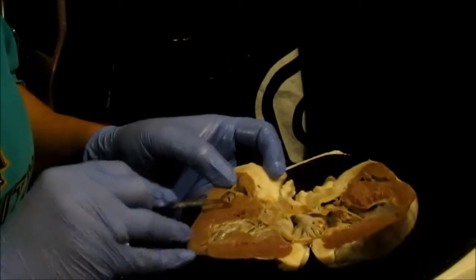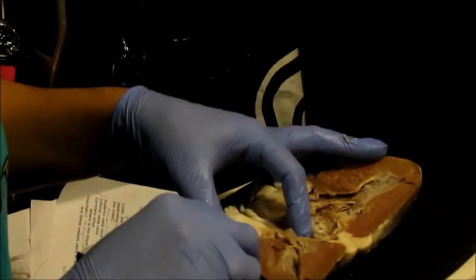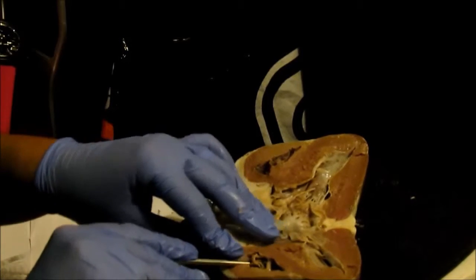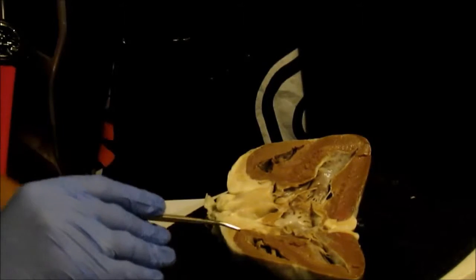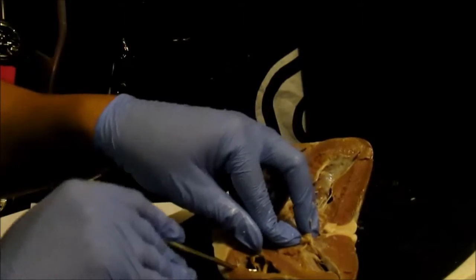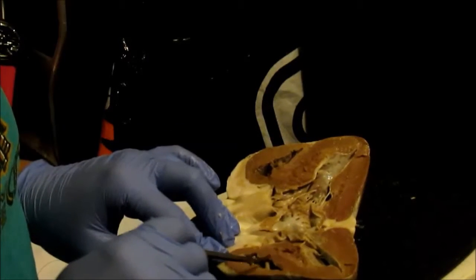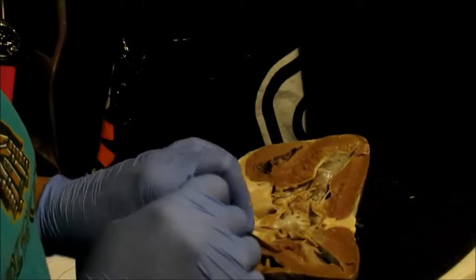So the tricuspid valve is actually in there, in the right ventricle. And these vessels are actually veins that go into the tricuspid valve. The three mentioned prior, the superior vena cava, inferior vena cava, and the coronary sinus, are all veins that go into here. So they're bringing back deoxygenated blood. So the right ventricle basically gets all the deoxygenated blood, and then it gets pumped.